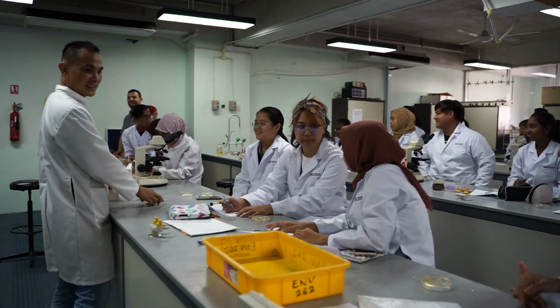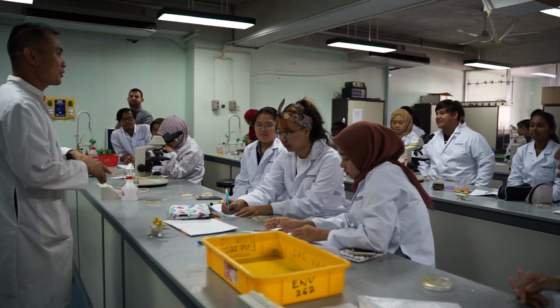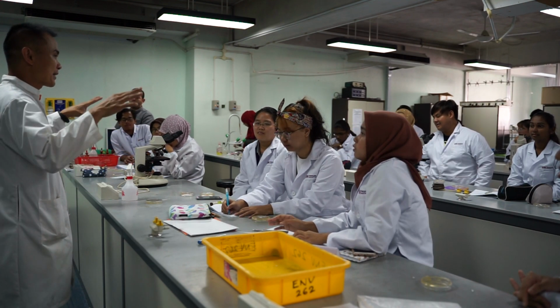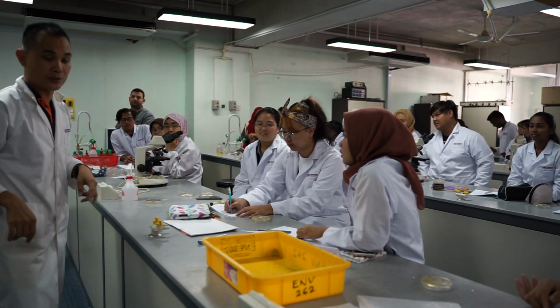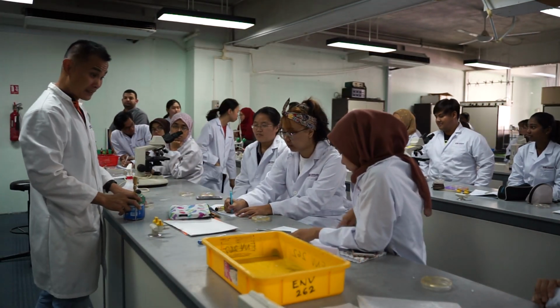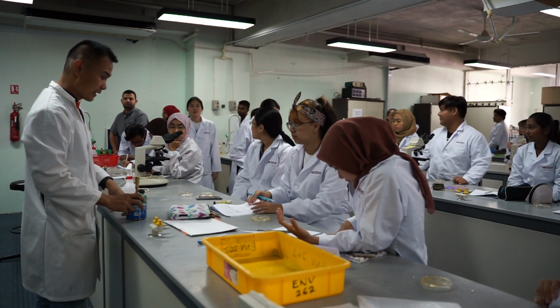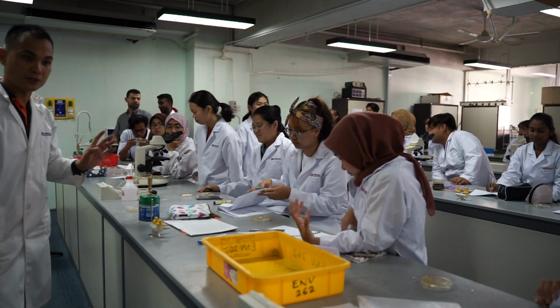Okay, so first, I'm going to show you all how to do streaking. Can you all see? I think people behind, maybe you want to come forward and see. If you haven't Googled it or looked at the YouTube, there is a YouTube link on your lab manual, you can go back and look at it. But if not, come here.